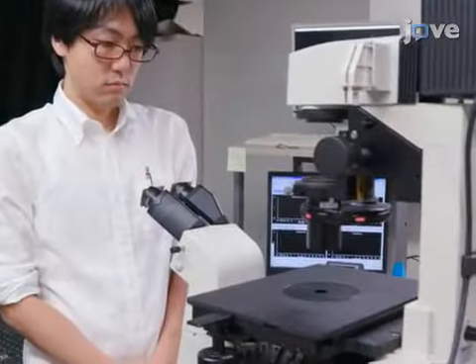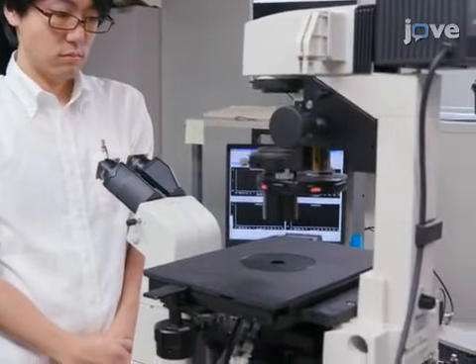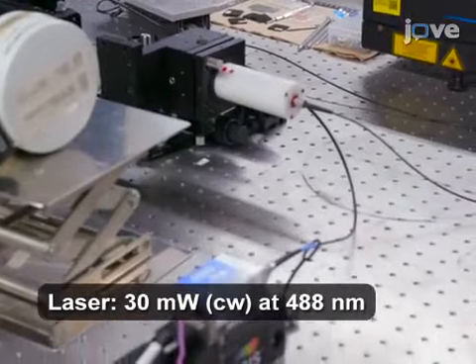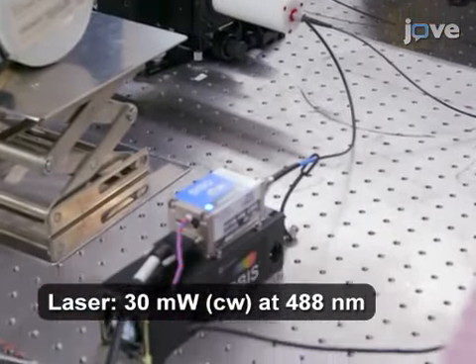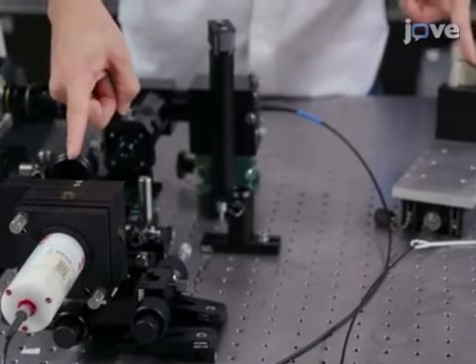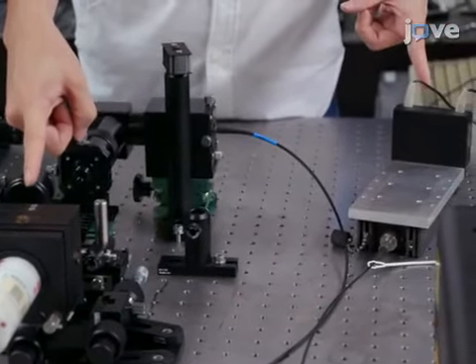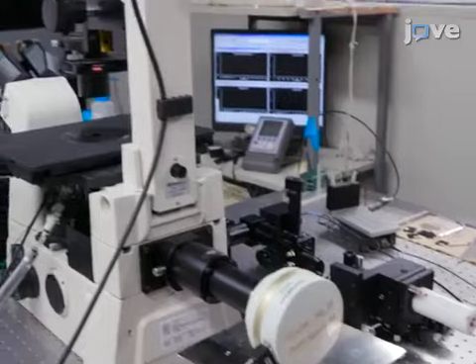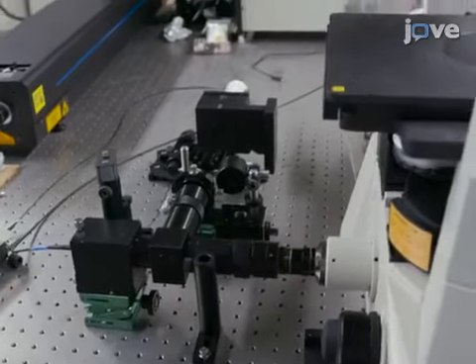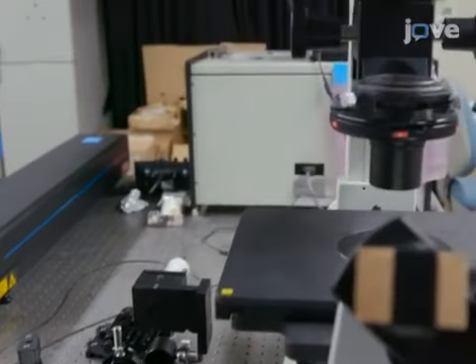This is the setup for the dynamic light scattering microscope. It has a solid-state laser capable of 30 milliwatts continuous wave operation at 488 nanometers. There is also an avalanche photodiode and autocorrelator connected to a computer for measurements. The inverted microscope in the setup has a stage with a temperature regulator. The box contains the remaining optical elements required for the experiment.